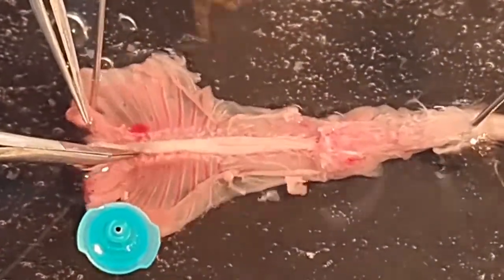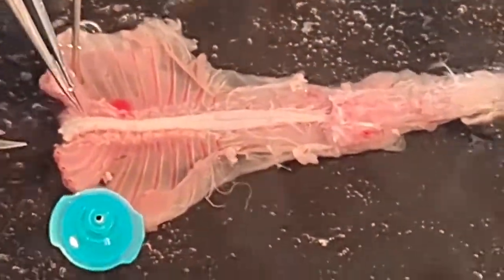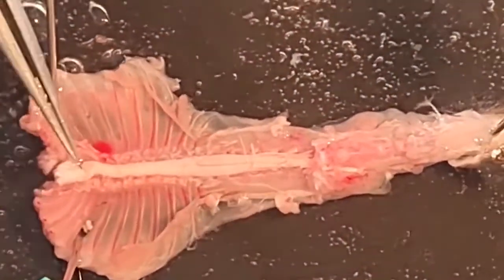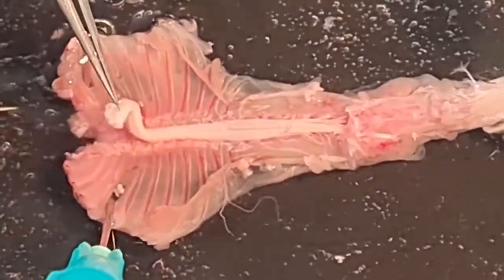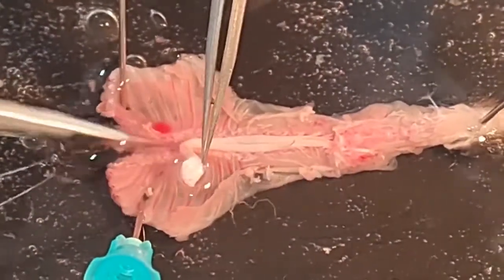By holding the pia mater with a fine forceps, you can carefully lift the cervical end of the spinal cord while using the fine spring scissor. Again, in an alternating manner, you're severing the dorsal and ventral roots that run towards the intervertebral foramen.